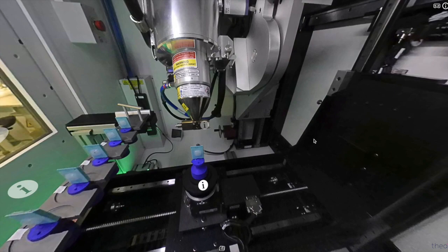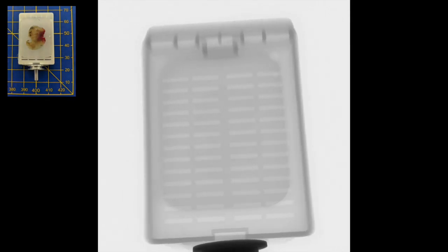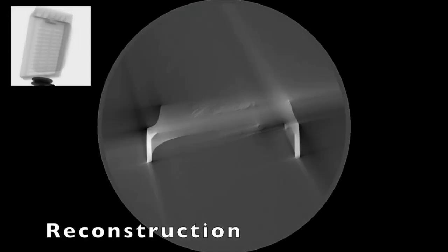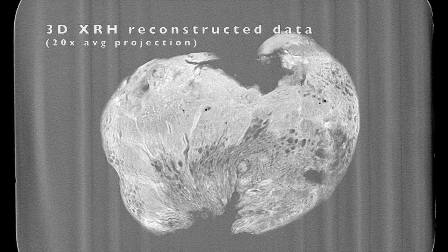In this particular case, a soft tissue specimen has already been placed onto the stage. That's mounted on a standard histology cassette and is ready for the acquisition to commence. During the acquisition, the specimen is rotated by 360 degrees and radiographs are collected on every single step. Each radiograph contributes a unique perspective of the specimen, and when combined using computer algorithms, the inner structure of the specimen is revealed.